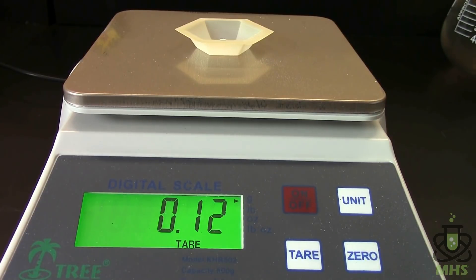There we go, that's something. So 0.12 grams of calcium carbonate. So I'm going to go do some stoichiometry and I will be right back.